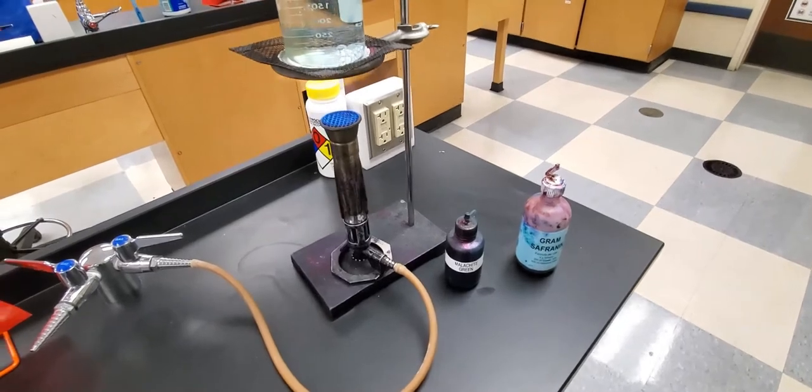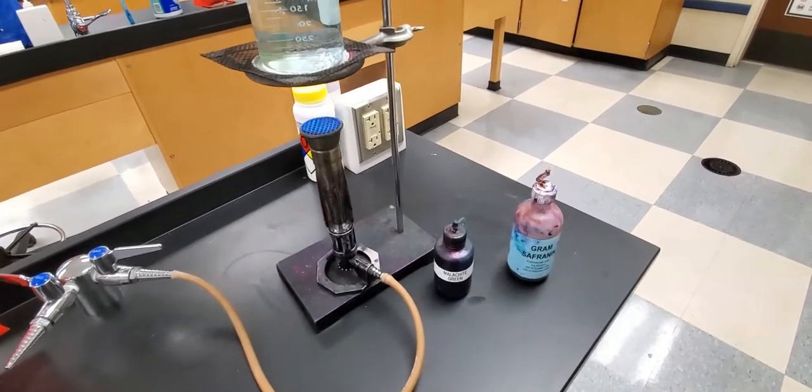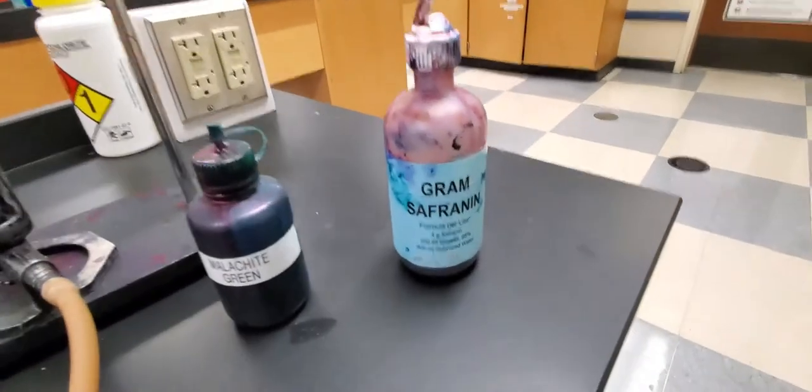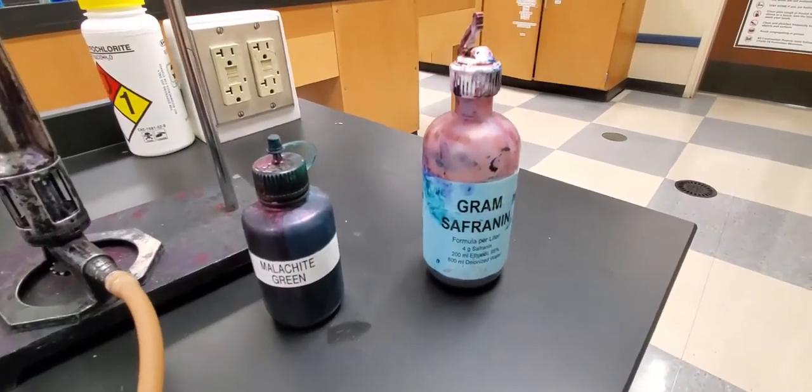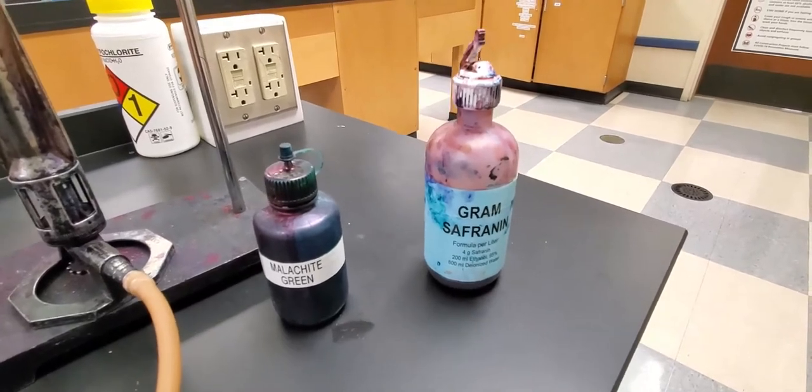Because we're decolorizing ourselves we're going to counter stain with our basic safranin stain so that the body of the cell will come out pink.